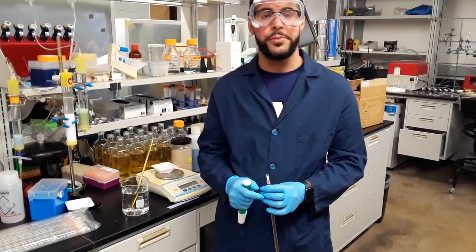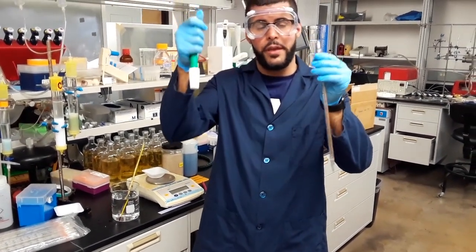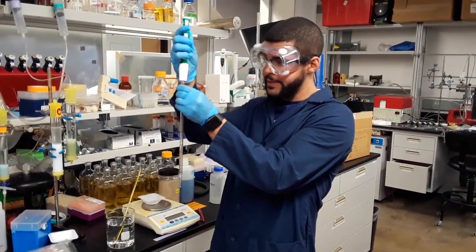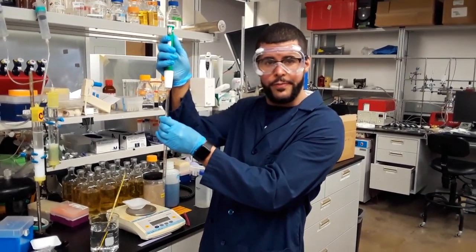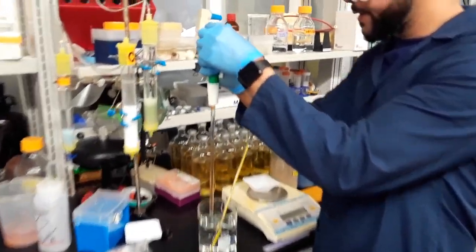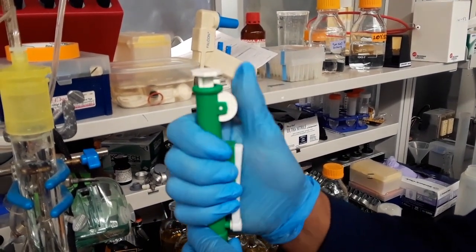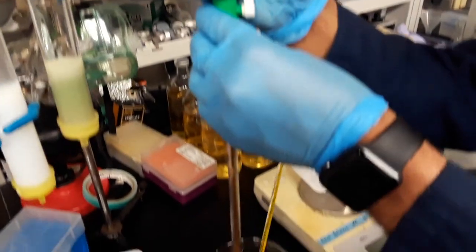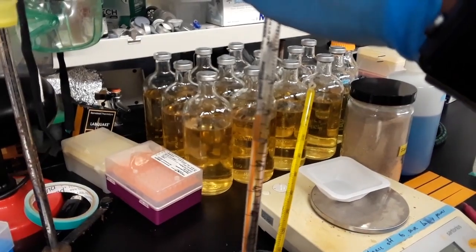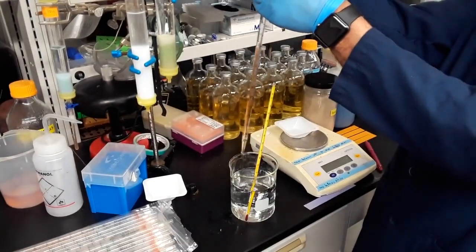The final piece of equipment that we'll be using to measure the water is a graduated pipette and a serological pipetter. The way that we use this is by placing the serological pipetter on top of the graduated pipette and slightly turning just enough to situate it so it doesn't fall. Then you will place the graduated pipette into the water, and here you have this dial, this wheel that you'll turn. And all you do is you just push down and the water will come up. And then in order to dispense it out of the graduated pipette, you'll just go the opposite direction.